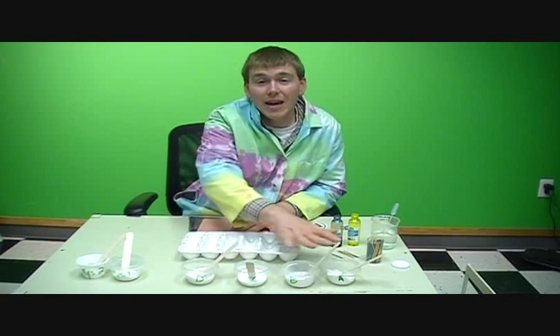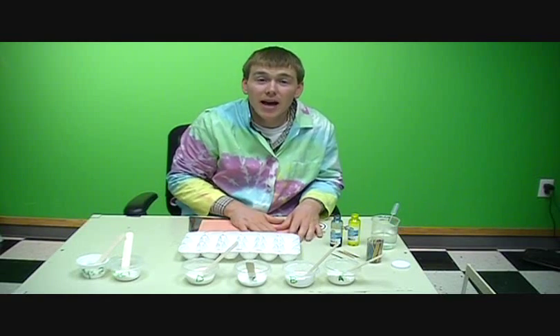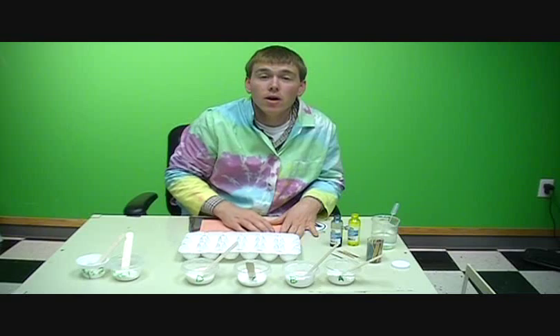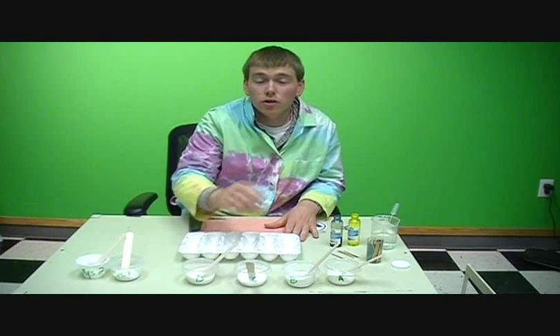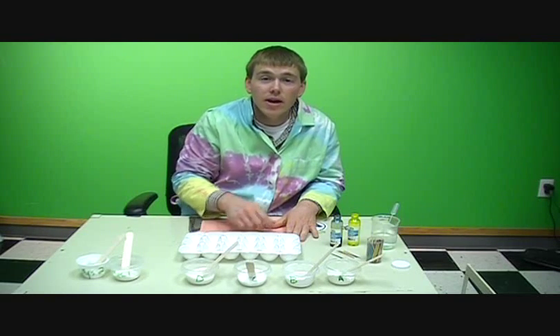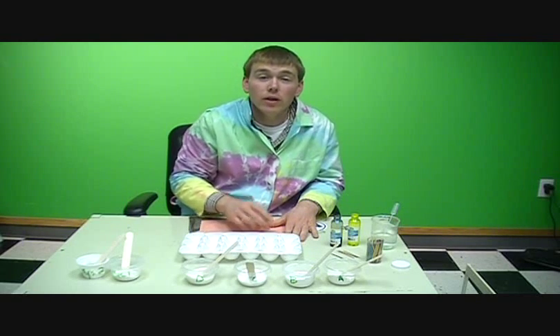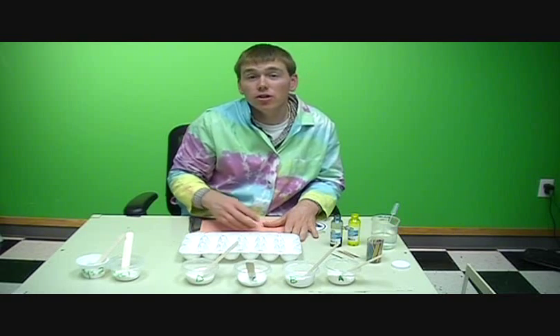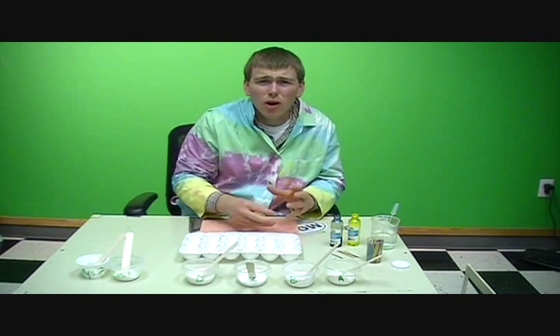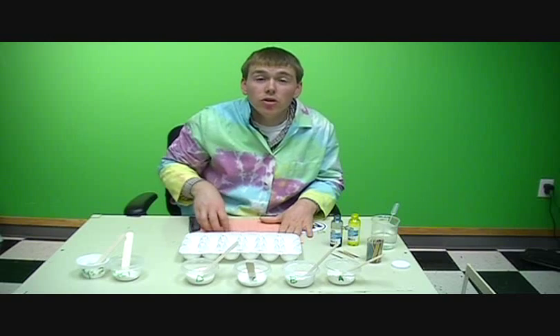Right? And the students are going to be analyzing these powders and recording that information on a data sheet, also below this video, and they're going to record all their observations of these different powders. First of all, what do they look like, and then as they add different liquids, water, vinegar, and iodine, how does each of these powders react with those different liquids? Is there a chemical change? Is it just a physical change? How would you describe the texture after you add these different liquids? So they need to make really good observations and collect really good data.